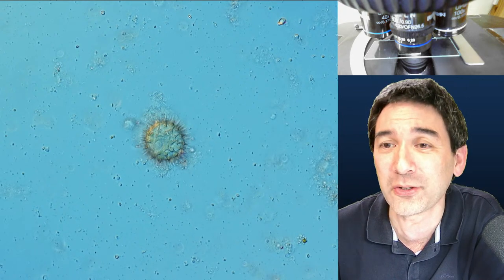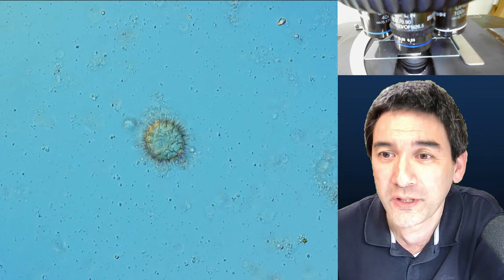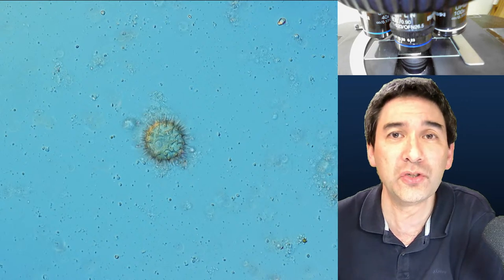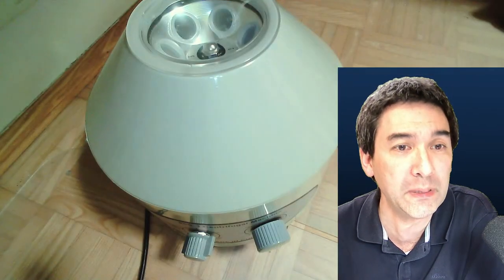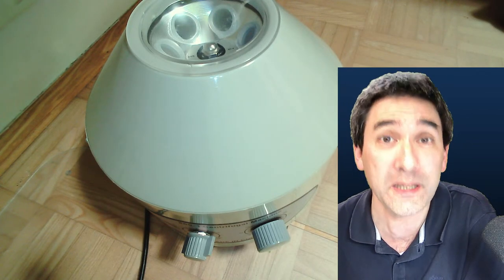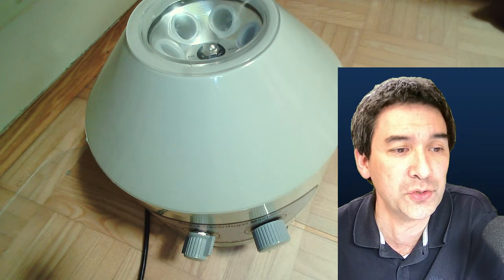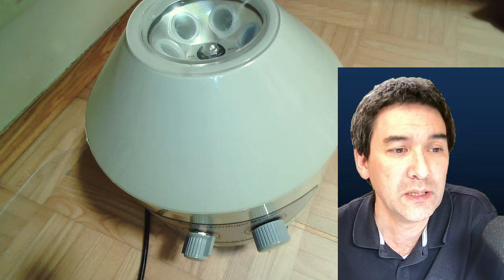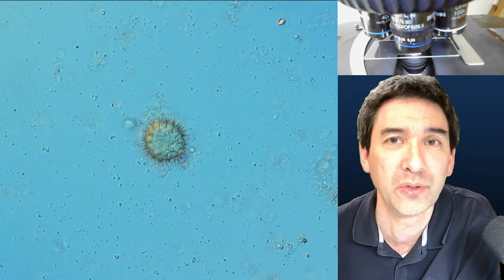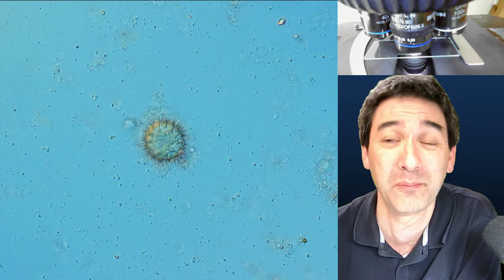I see that many people already started to join in from all over the world, and more and more people will join over the next couple of minutes. What I would like to do today is use my centrifuge, which I placed on the floor here, to do a little bit of centrifuging of honey. I would also like to show you how I'm concentrating the specimens and show them under the microscope, and share a few resources about pollen identification.